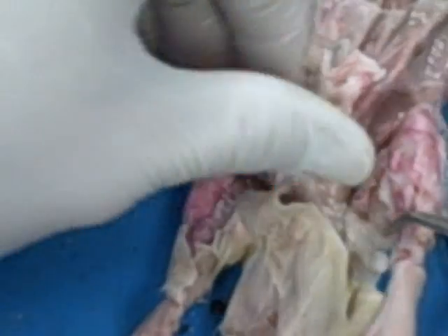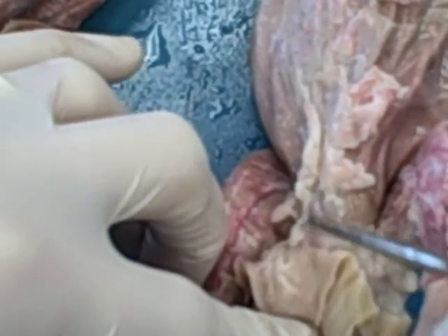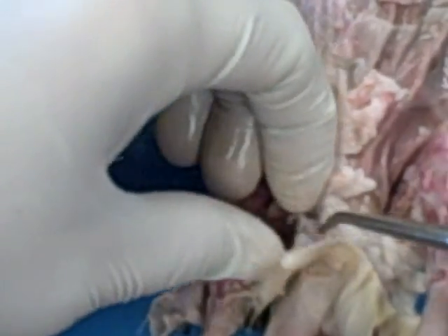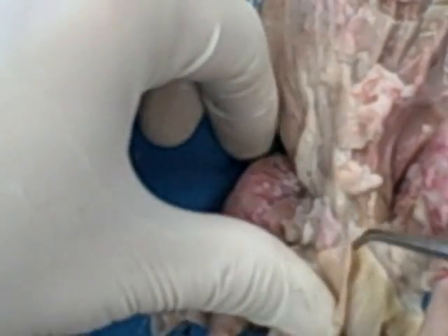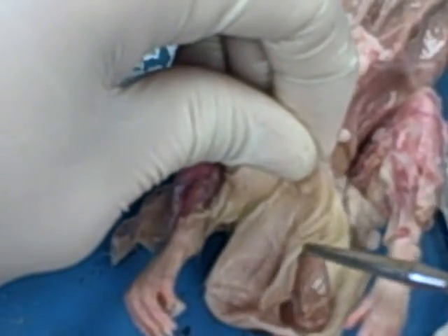The last bit is the penis of the rat. The penis is not readily obvious, but it is a structure that is just cranial to the testes. What you'll see when you look is it might have a little ridge that sticks up of pinker tissue that's more dense than the surrounding tissue. So I do want you to know that as well. So the penis, the containing sac of skin, the scrotum, within it the testes, and then the anus. And that is your rat external anatomy.